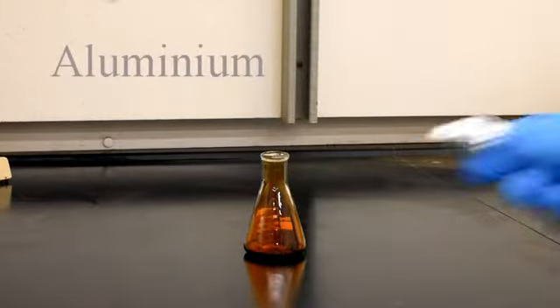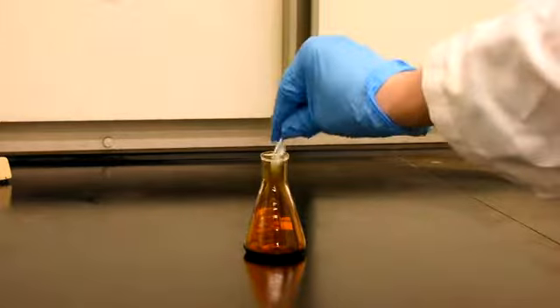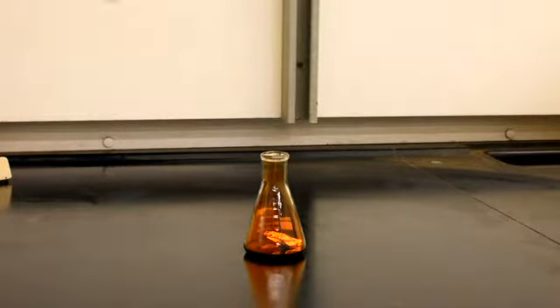The first reaction we're going to show is bromine reacting with aluminium. The aluminium is in the form of aluminium foil. So we've dropped a small piece of aluminium foil into the flask containing bromine.